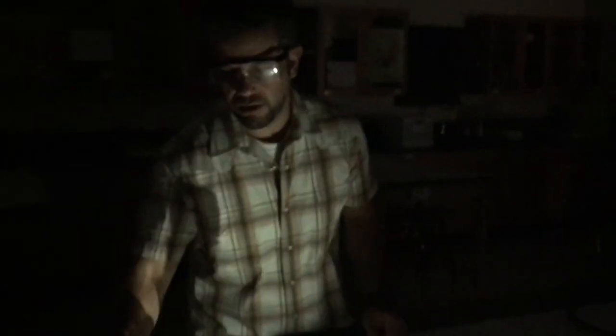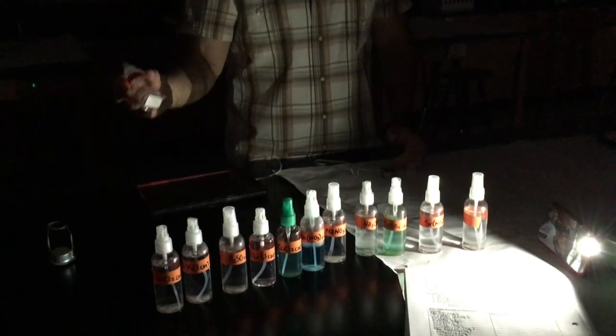All right, so basically what we got going on is we got them all lined up in the order that you see on your lab sheet here. These are all saltwater solutions. Big thing to remember with the flame, you want your sleeves rolled up, you want your hair tied back, safety goggles on, and the spray bottle, you want to make sure that you're not spraying it anywhere towards your lab partner. I've got white paper underneath here, and so now I'm going to spray it towards the flame here, away from my partners.